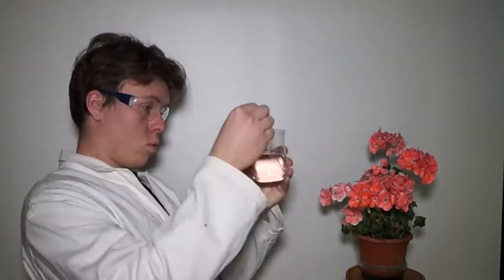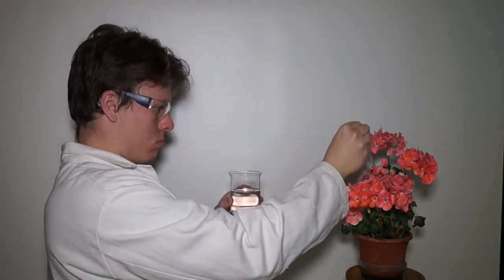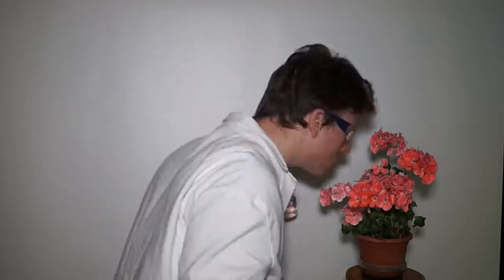Hello everyone! In this episode, I'll show you an amazing reaction between ethanol and potassium permanganate.